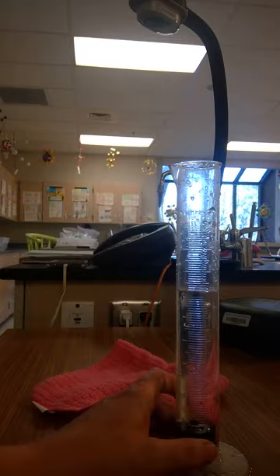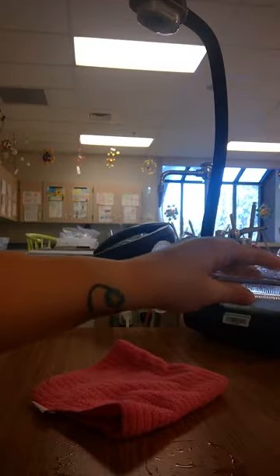So go ahead and do the subtraction problem so that you can solve for your volume. Milliliters is what we used water to help us. And then we convert that to cubic centimeters because we know it's a solid object. So the next thing we have to do is we're going to find the mass of each of these items.